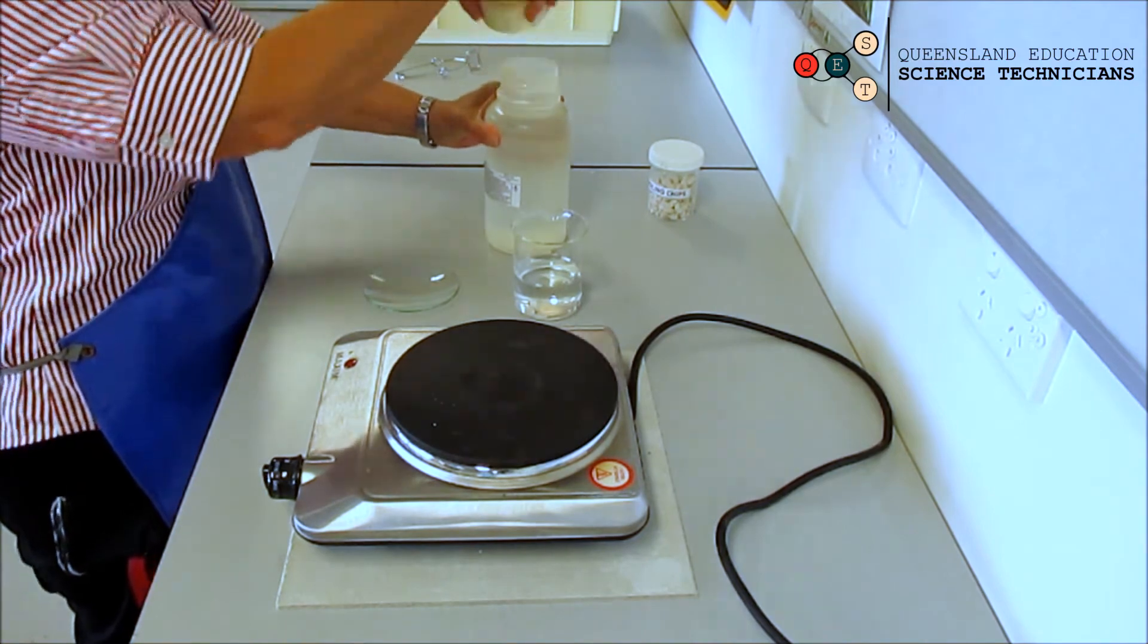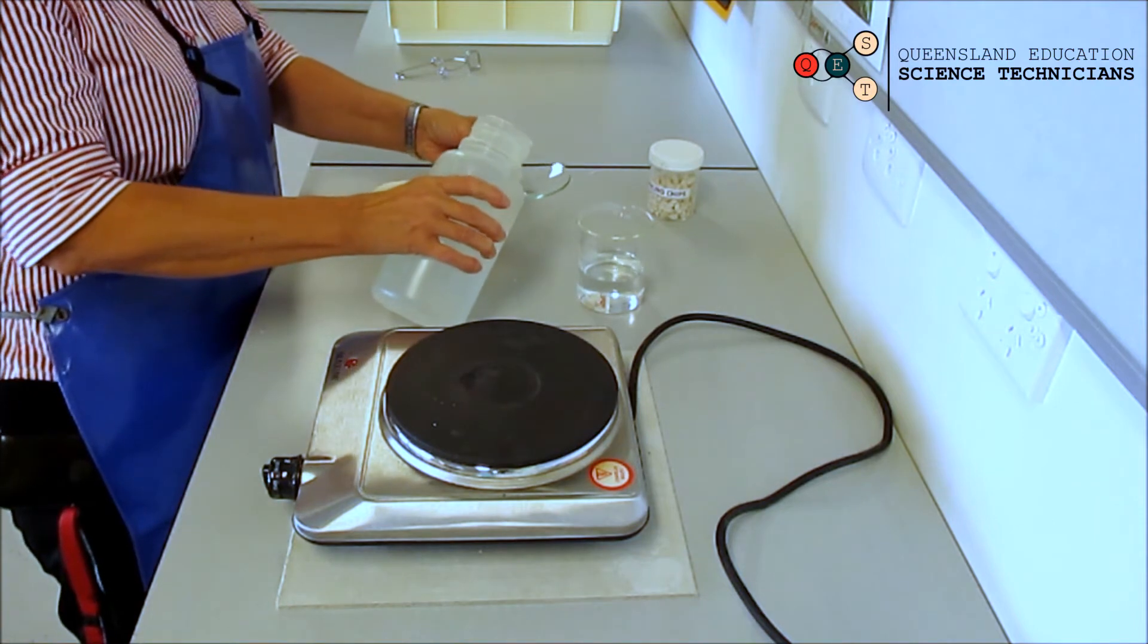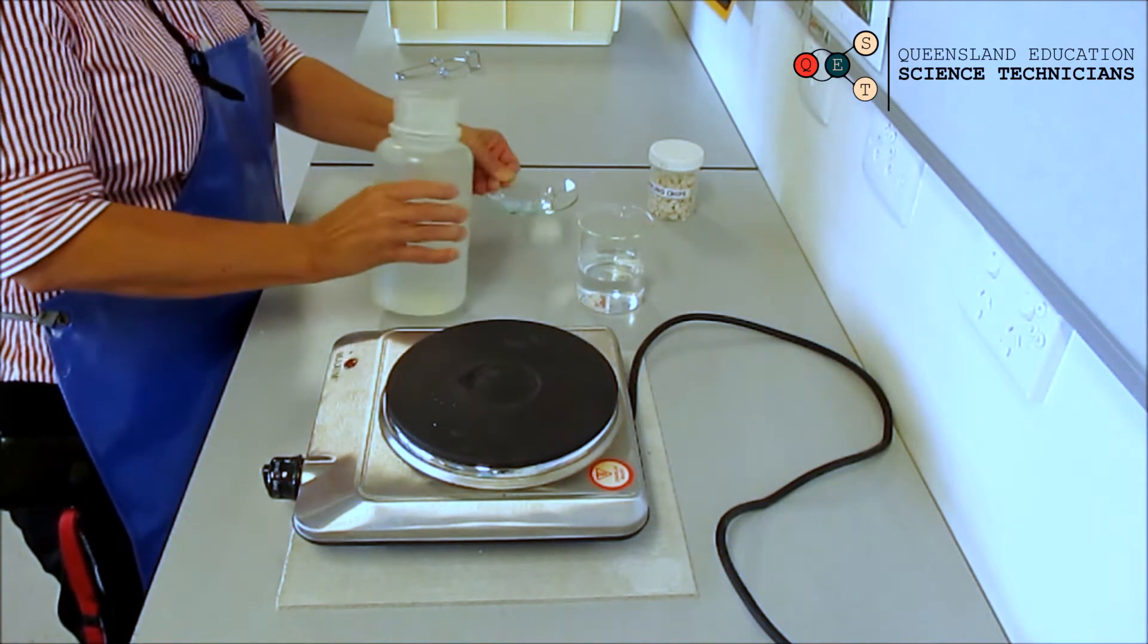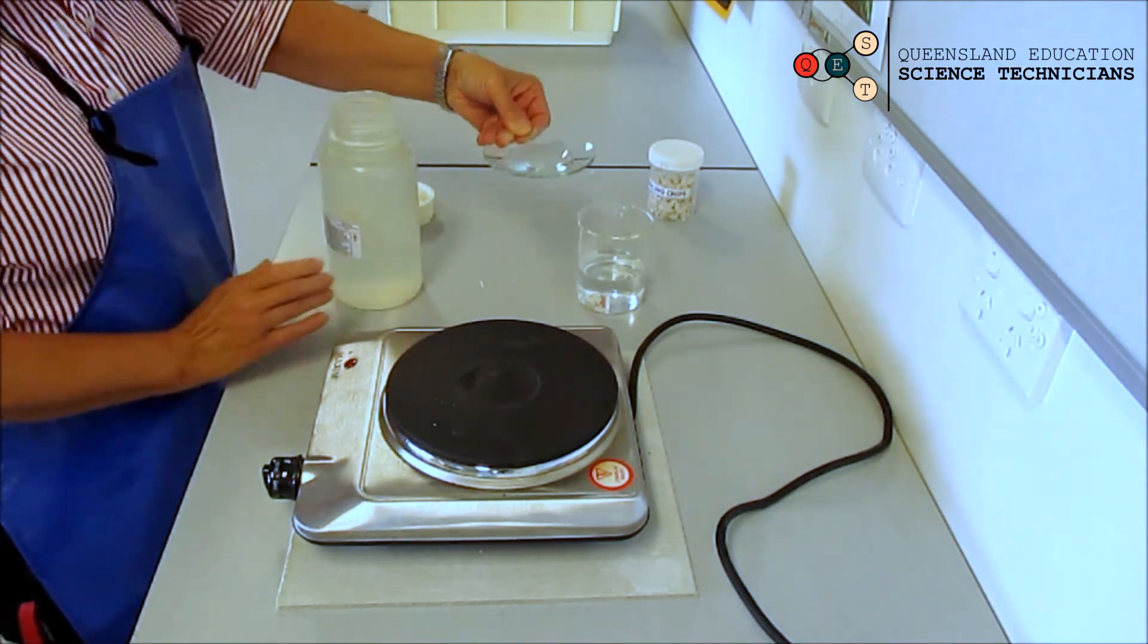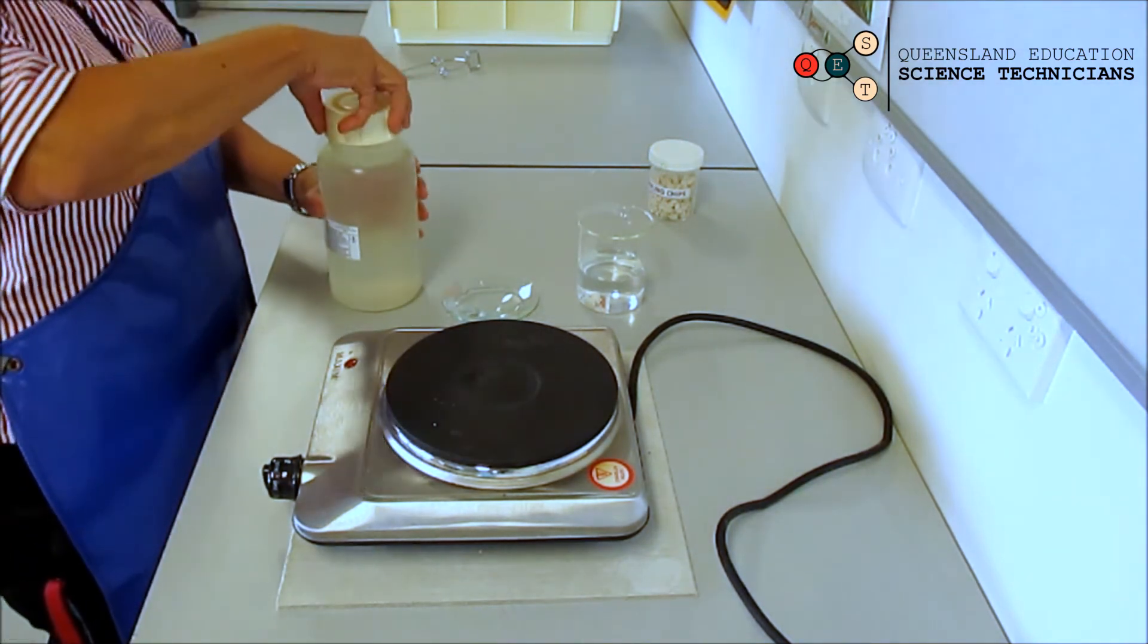You will put just enough on your watch glass.